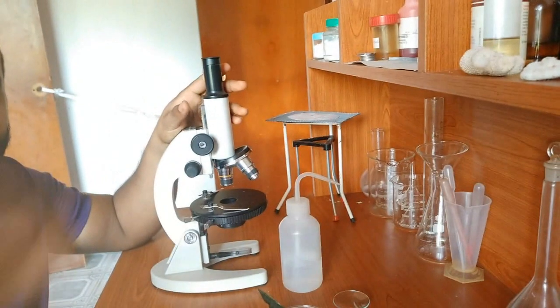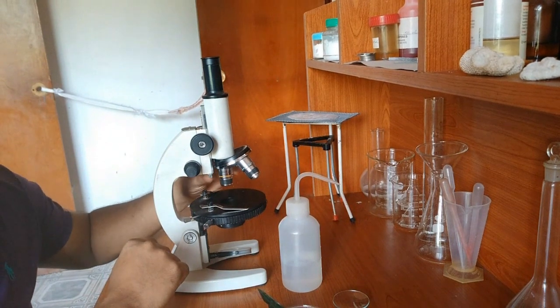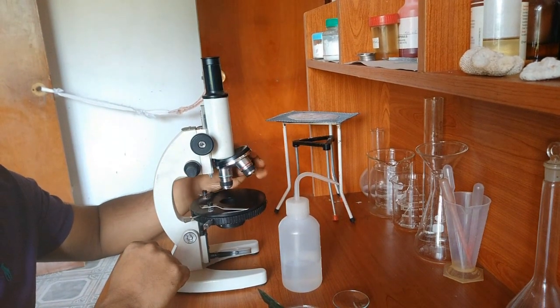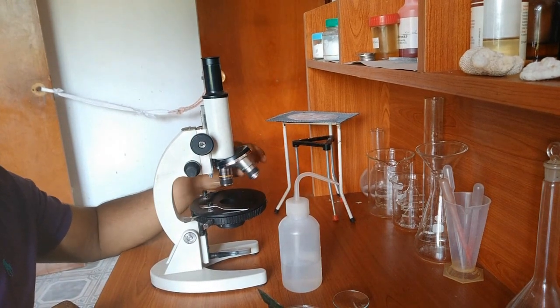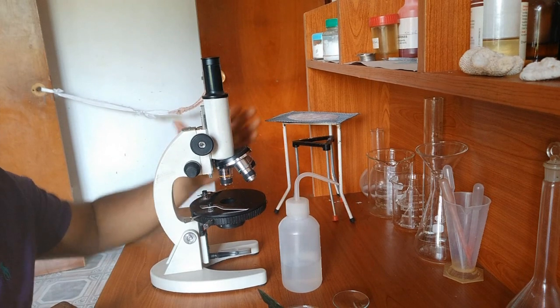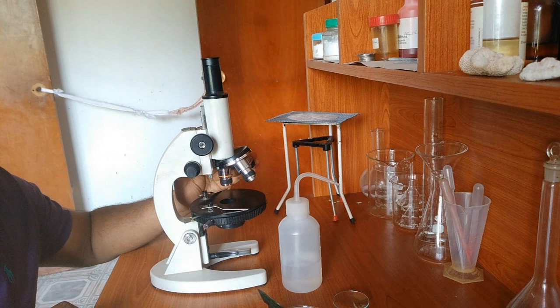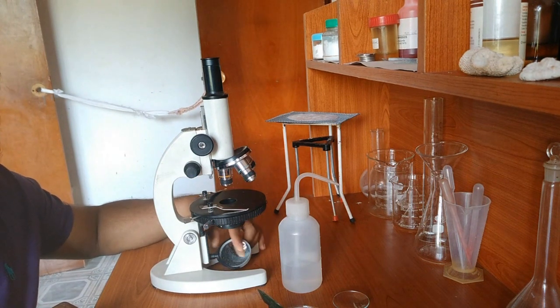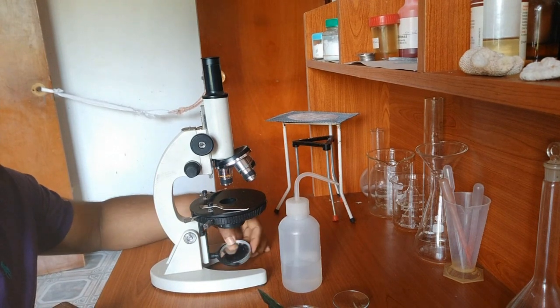The reason is, you can see in here there's the eyepiece lens and this is the objective lenses. There are 3 objective lenses and the nose piece you can rotate that. So you can understand why we call it a compound light microscope. The reason is you have 2 lenses, 2 or more lenses that will give a huge magnification. And this is the mirror. So from this mirror what we can do, we can reflect the light. That's why we call this the light microscope. So let's see how we prepare this.